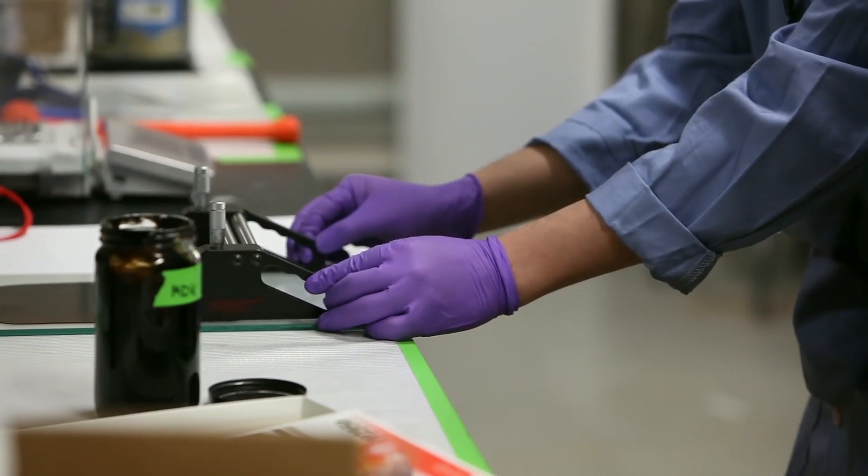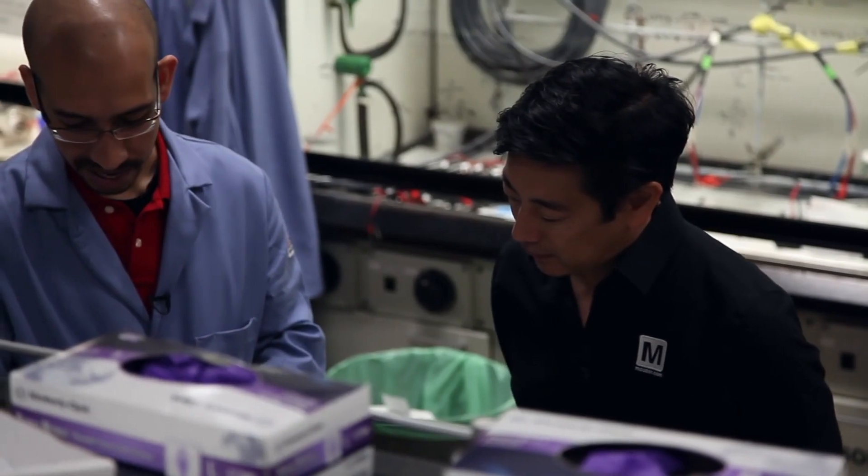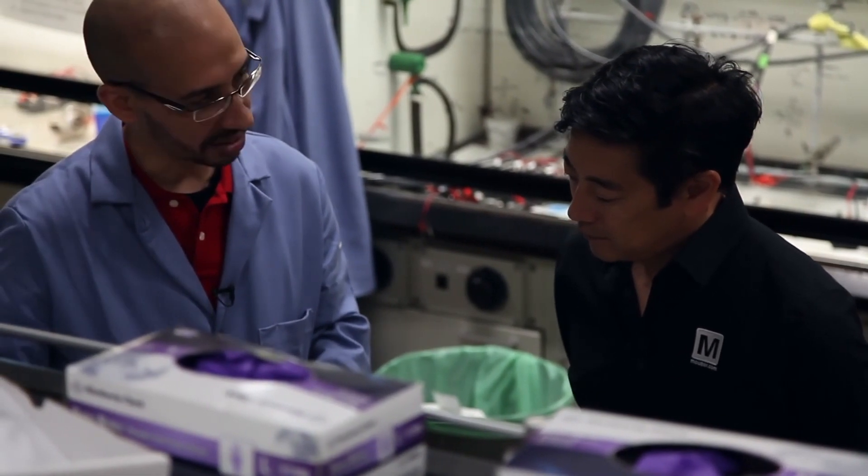So this instrument is just giving you a really uniform layer — that's all it does. Now we have that layer of graphene oxide coated on the sheet of plastic. The next step is just to dry this up — you can put it in an oven. How long will that take? About 30 minutes. Okay, cool, let's do it.